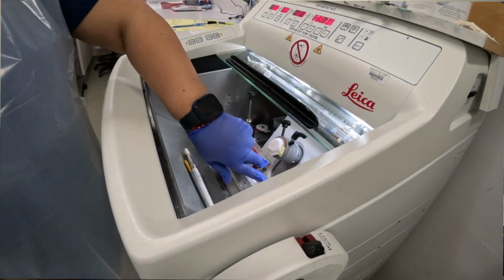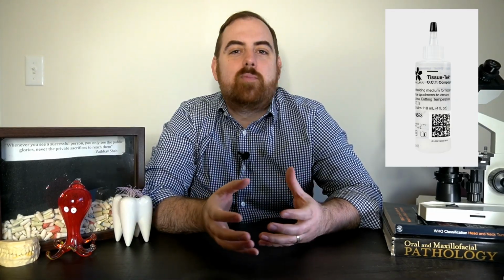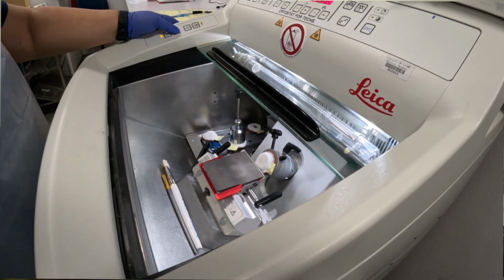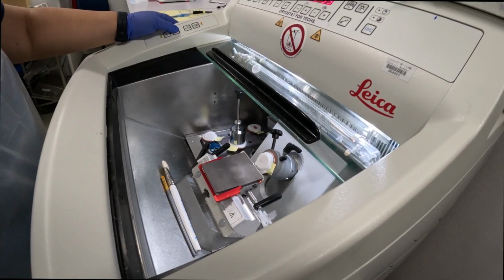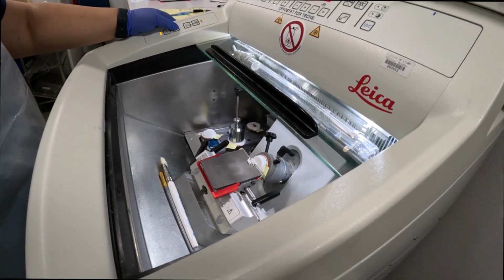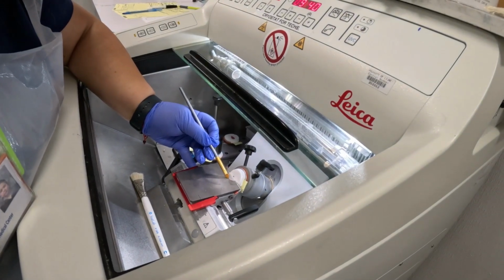we're looking at. Next, we place the tissue on a flat metal disc covered in a special medium that freezes quickly. It starts as a gel and then becomes essentially a block of ice very rapidly. We orient or lay out the specimen in the way that we want to examine it and then cover it with the freezing material so that it becomes buried. We cut into that buried specimen until we reveal the tissue. We then carefully take a thin ribbon of the specimen with the medium and place it on a slide.